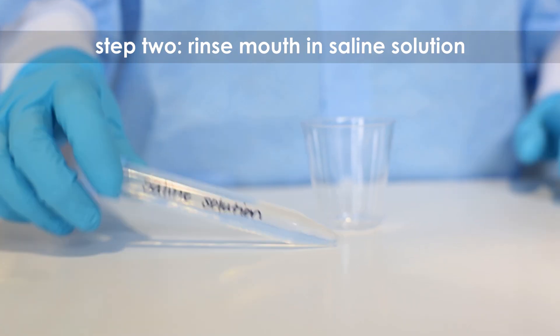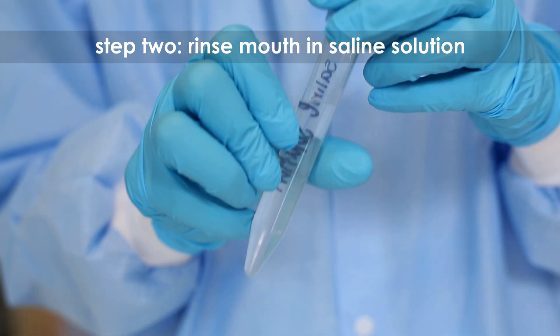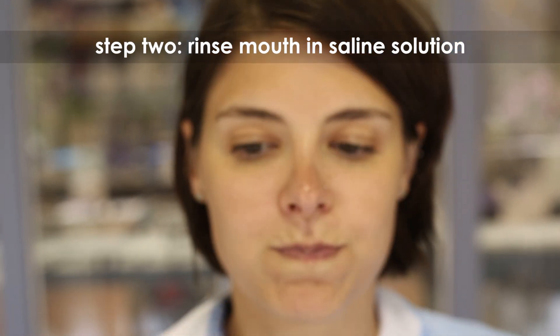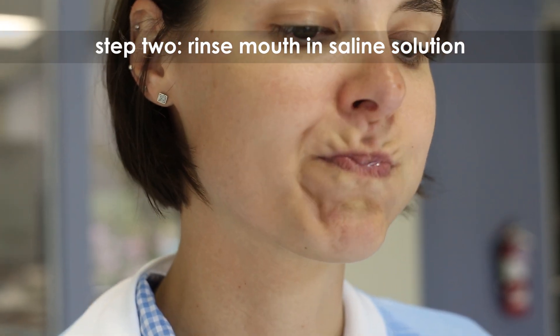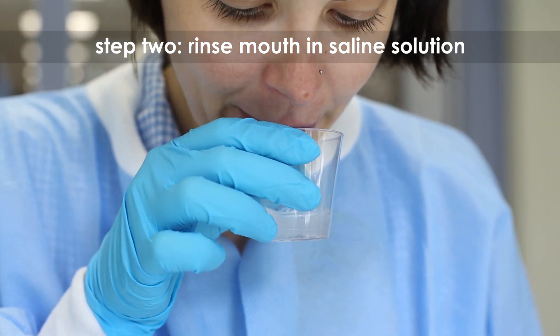Step 2: Rinse your mouth vigorously for 60 seconds using 10 ml of saline solution. Expel the solution into the plastic cup.